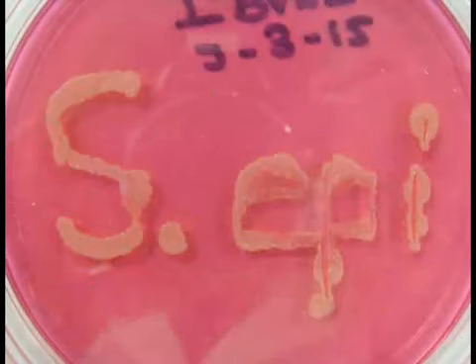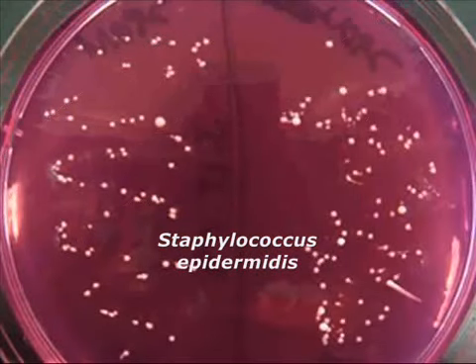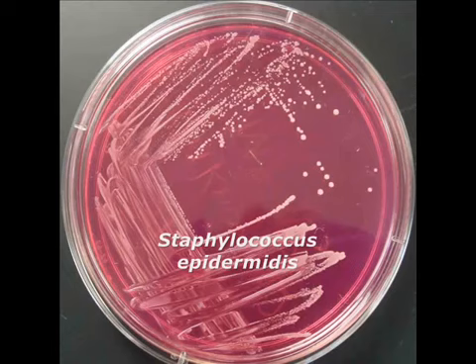Here is Staphylococcus epidermidis, normal flora that will grow on mannitol salt agar but not change the color of the medium. Here's Staph epi from two nasal samples growing in their characteristic punctiform small white creamy colonies. And here's Staph epi on mannitol salt agar. These bacteria were streak plated.